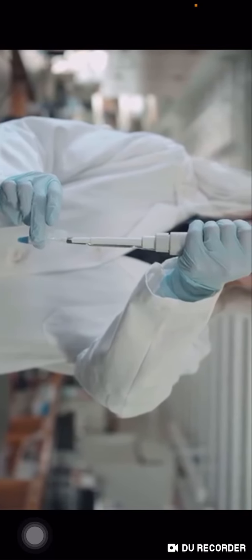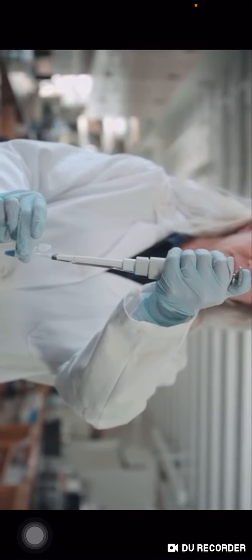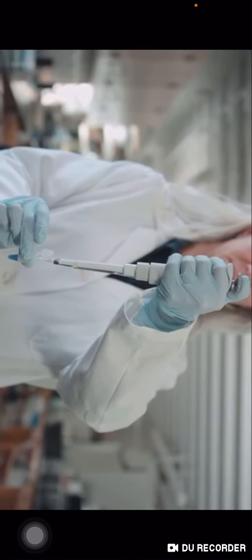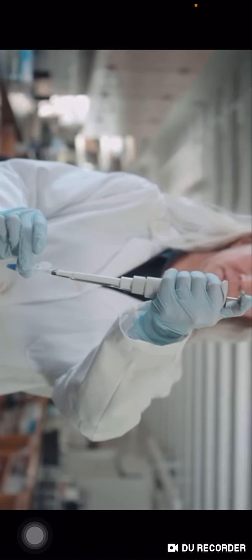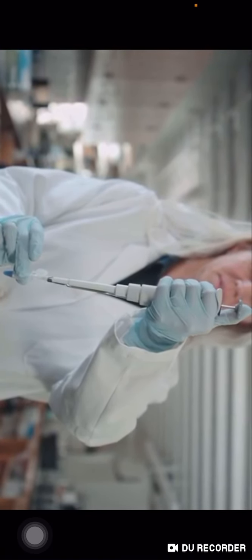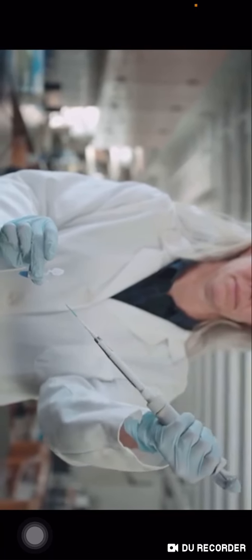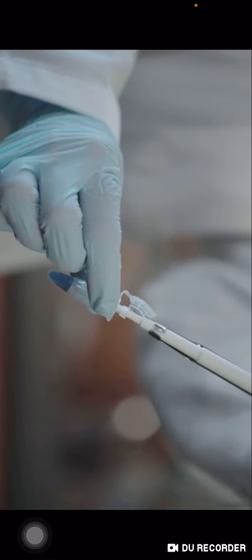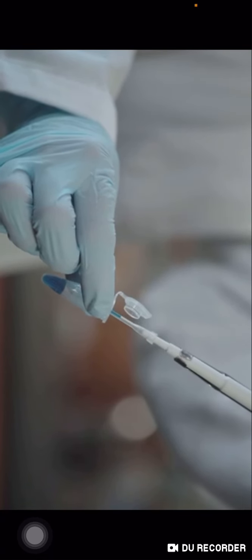The pipette plunger is operated by pushing down the button on the top of the plunger. The plunger has 2 stops. To draw fluid up into the pipette tip, push the button down to the first stop. Continue to hold down the button. Place the pipette tip into the fluid that you want to draw up. To draw up the fluid into the pipette, slowly release the button.